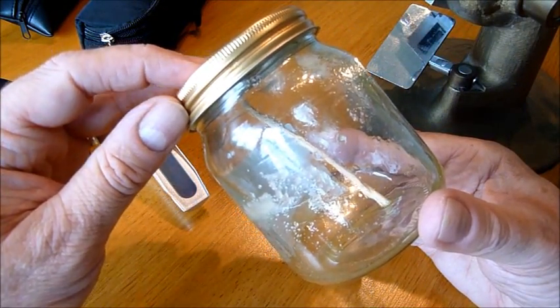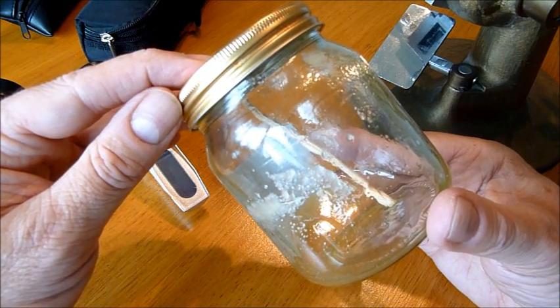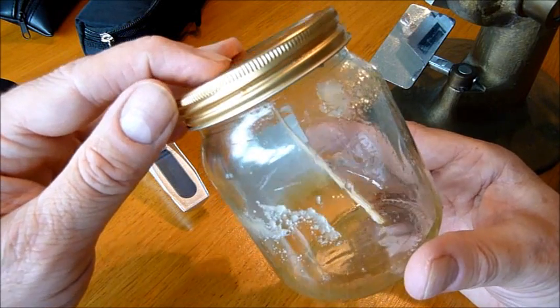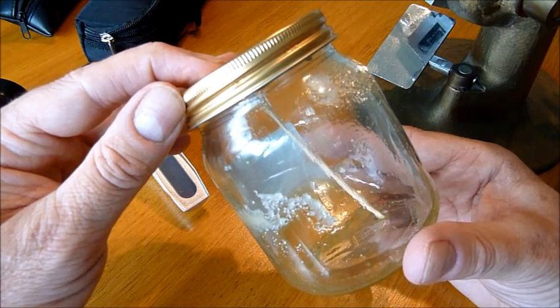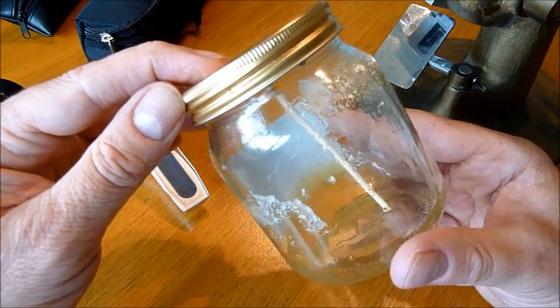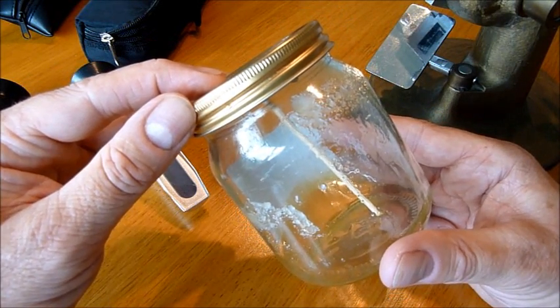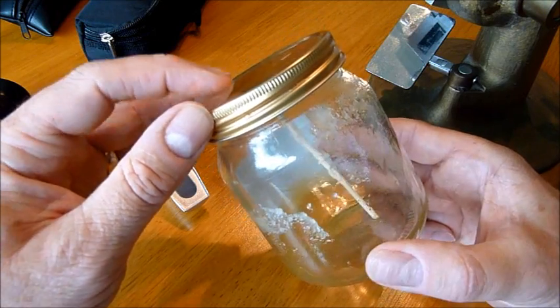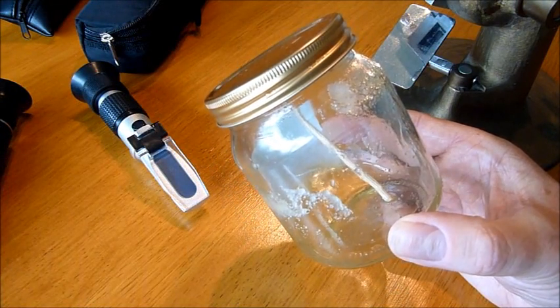Here's the honey sample we're going to be using today. It remains one of the first jars of rape from this year. Now in this instance it's actually quite easy to do this test because this has been sat in the kitchen, it's roughly at 20 degrees. My refractometer is also at 20 degrees.